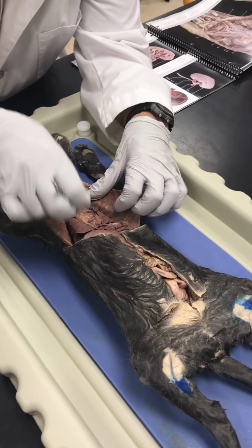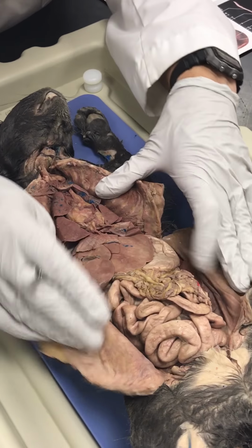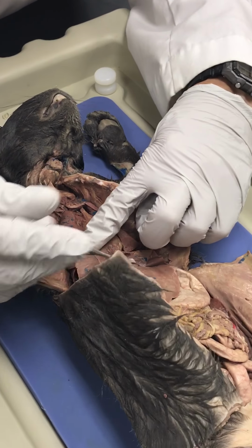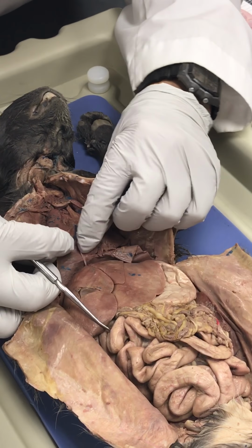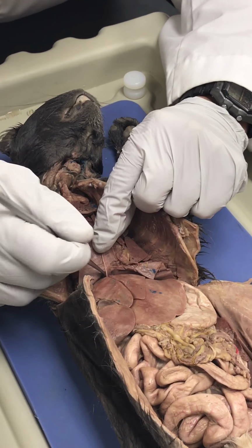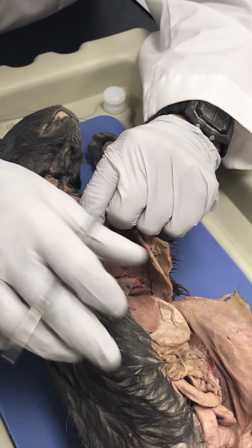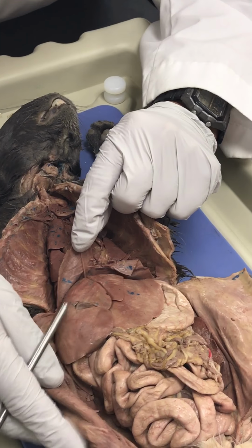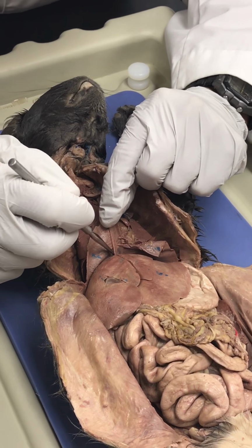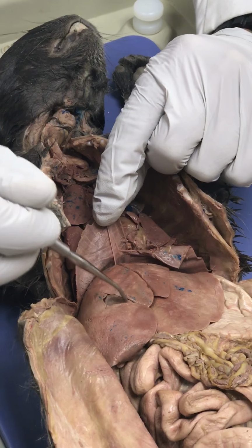Open up the abdominal wall or the thoracic wall, and this cat just opens up so beautifully. So here is the diaphragm, and we're going to peel back the diaphragm, and we can see that there's this piece of tissue right here that bisects the right and left lobe of the liver. The liver, okay? So what ligament is this? The falciform. Falciform ligament, all right? And they're cradled in the right lobe.